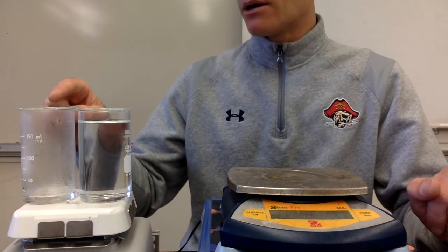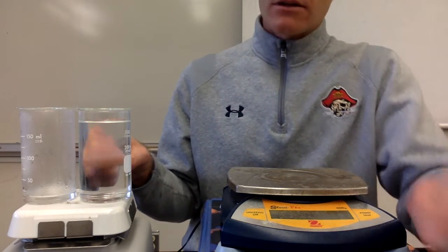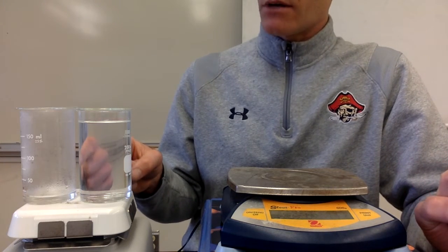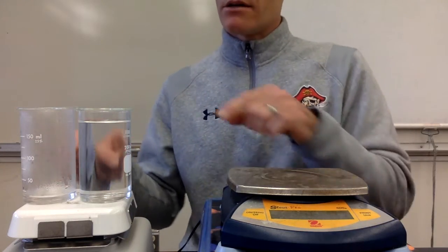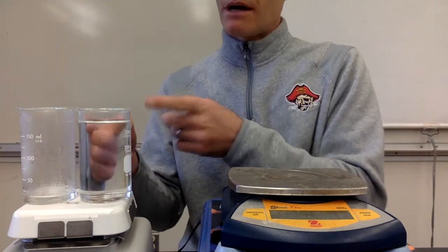Okay, yeah, it's already starting to boil a little bit, so that's good. And at the same time, we have this larger container of 9.9 degrees Celsius water. And we're going to see how much heat this one absorbs. The assumption we're making here is that these are both in the same kind of beaker on the same hot plate, so they're both absorbing the same amount of heat.